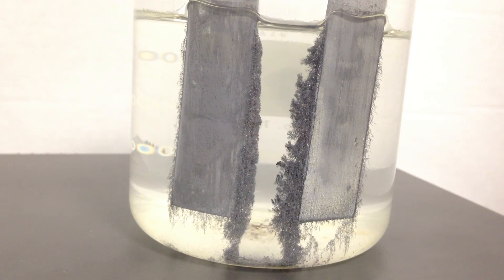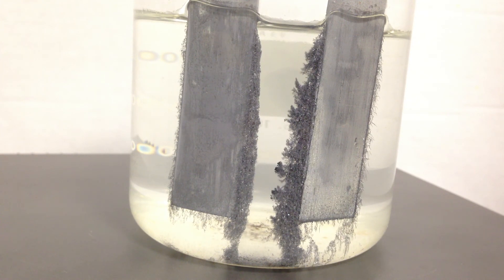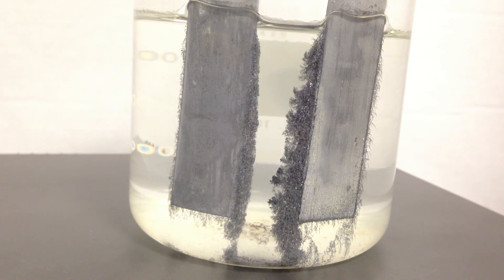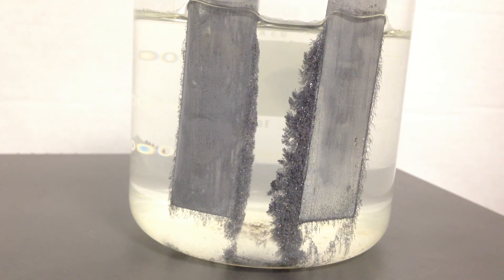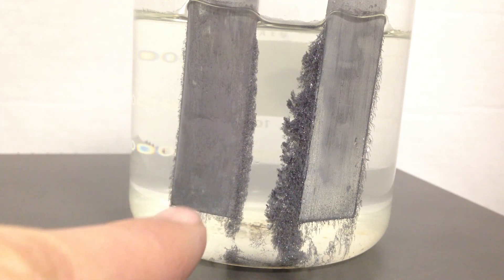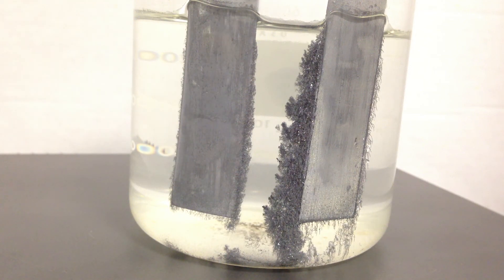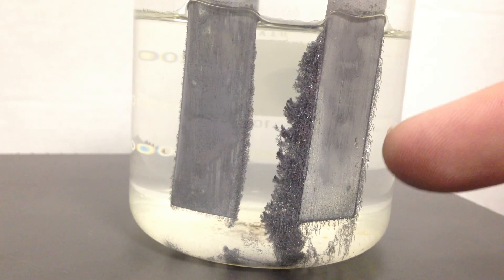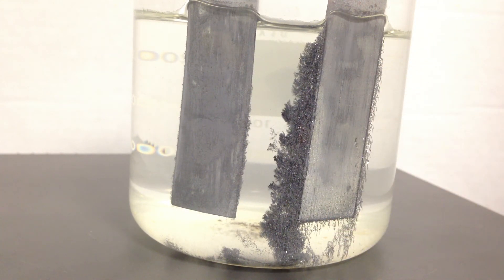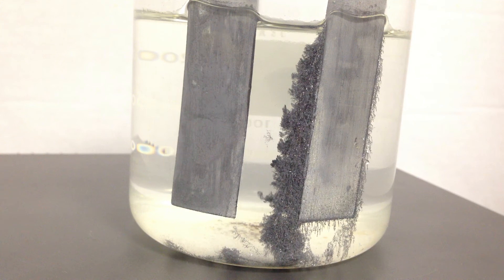That's a great example to show and talk about electrolytic cells, especially electroplating. You can see that lead is growing on the right like a chia pet, while the lead on the left is clearly getting smaller as dissolving occurs — lead⁰ going to lead²⁺ at the anode. That's oxidation. And we see lead²⁺ becoming lead⁰ solid at the cathode. We've essentially just switched the two roles of each electrode.